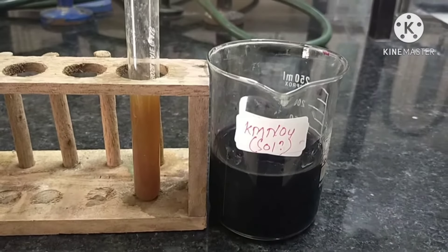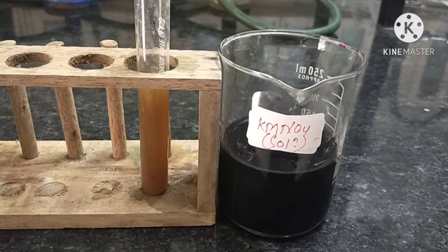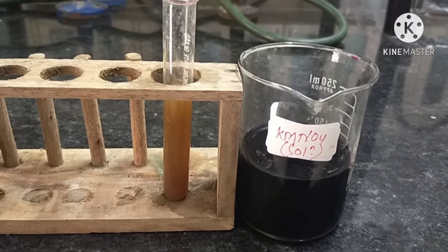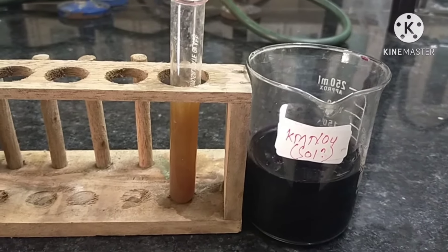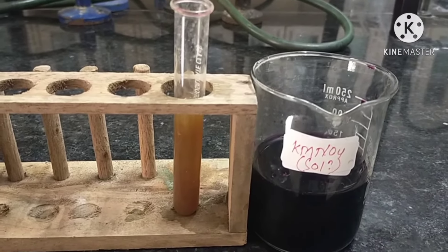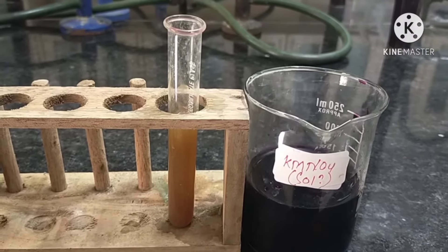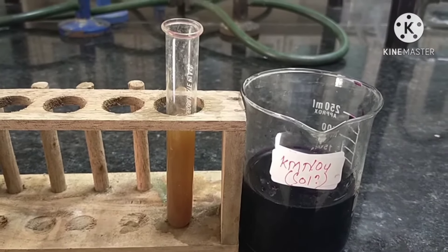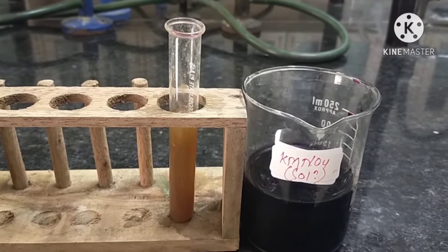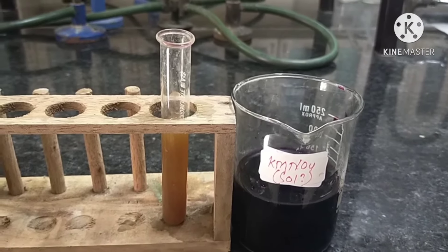We observe that the pink colouration of KMnO4 has disappeared after adding it into this test tube. We conclude that the oxidation of ethanol has taken place, which means ethanol has turned into ethanoic acid.